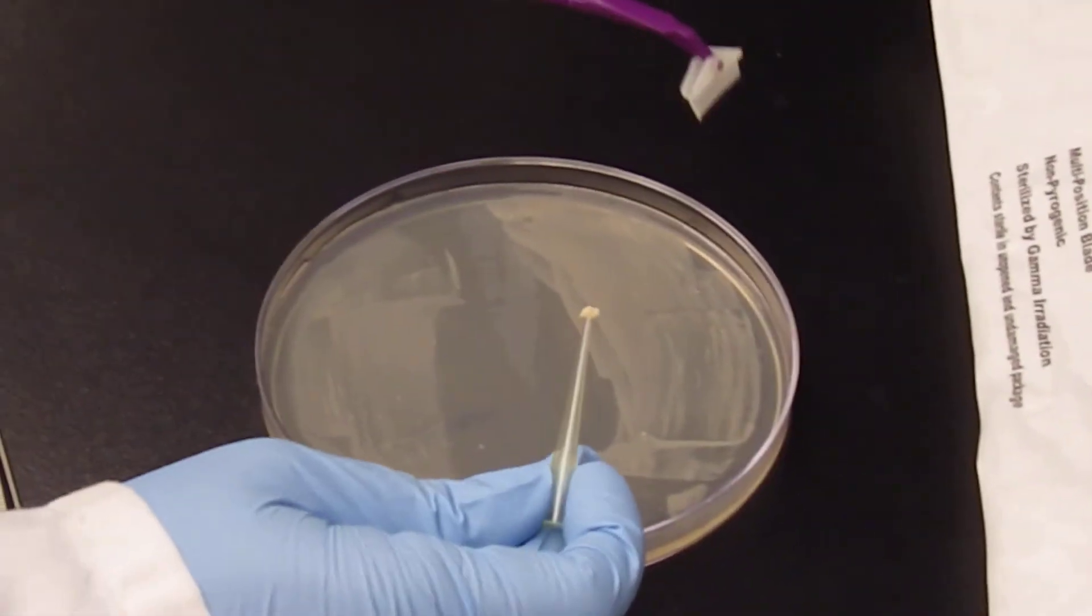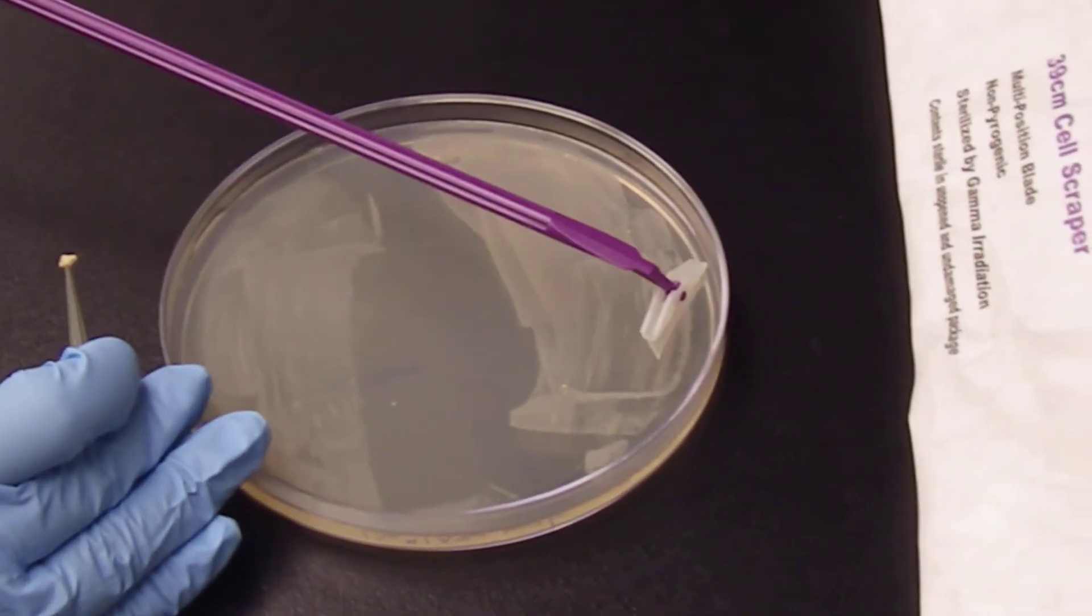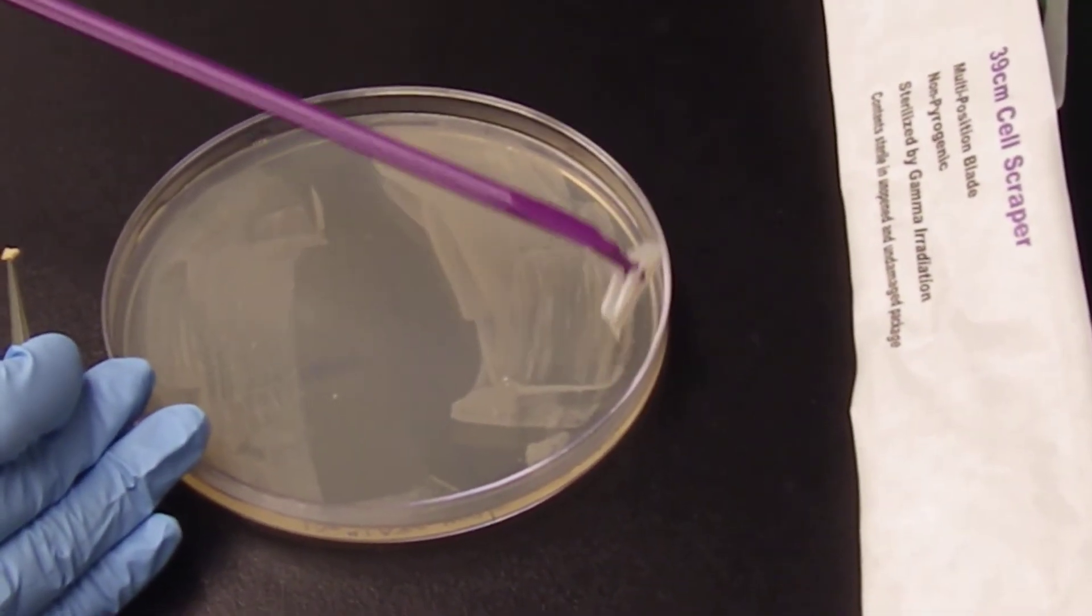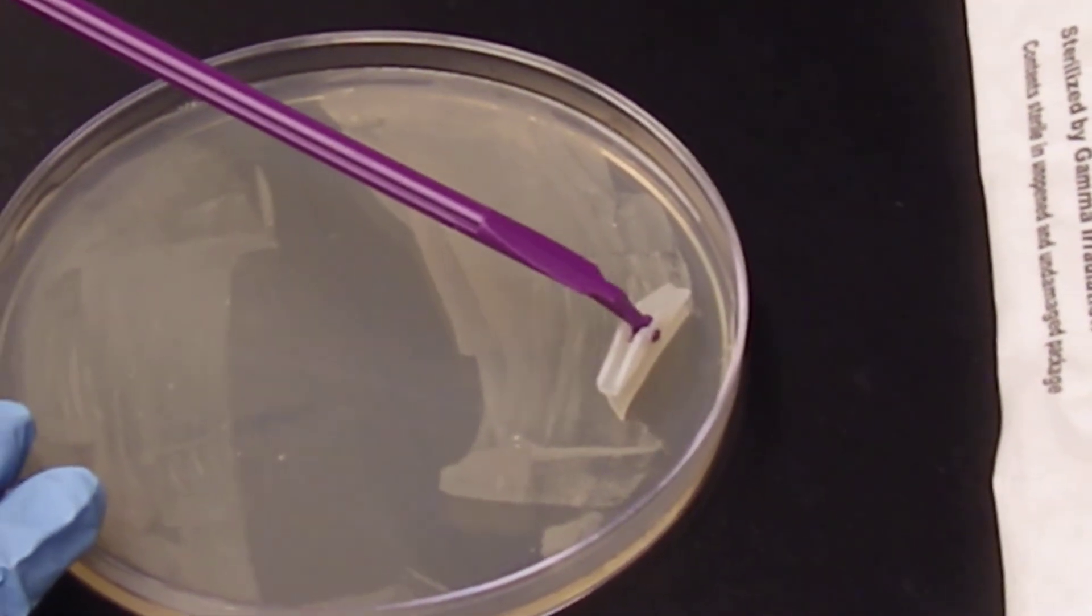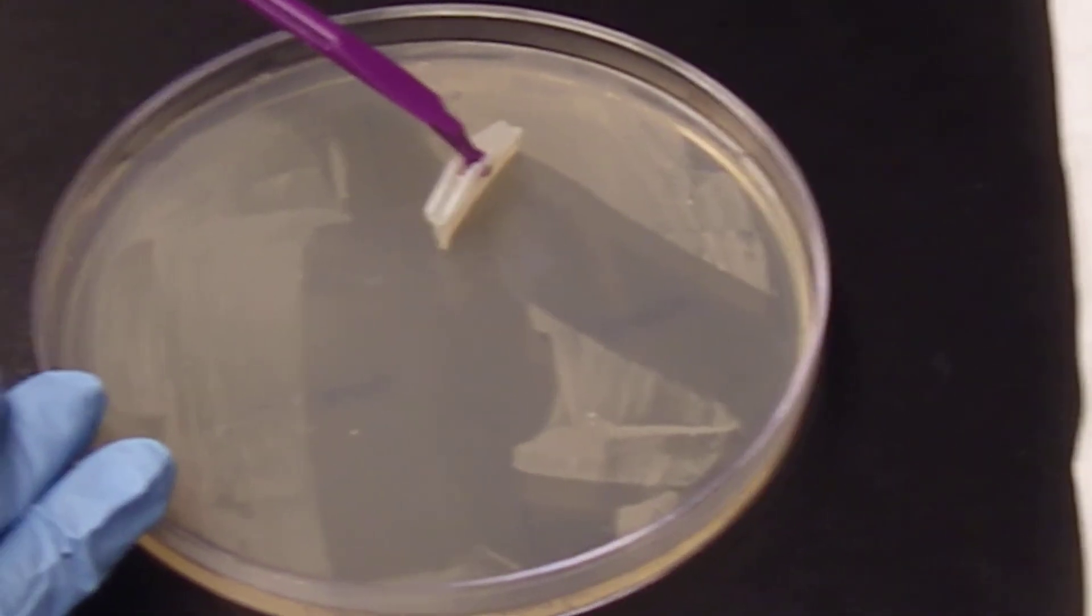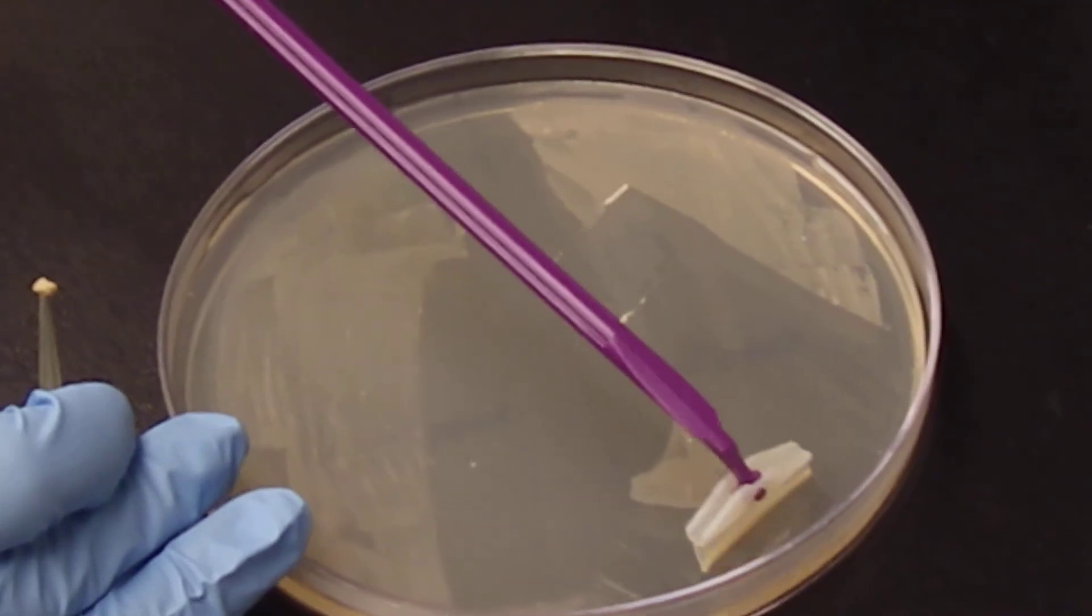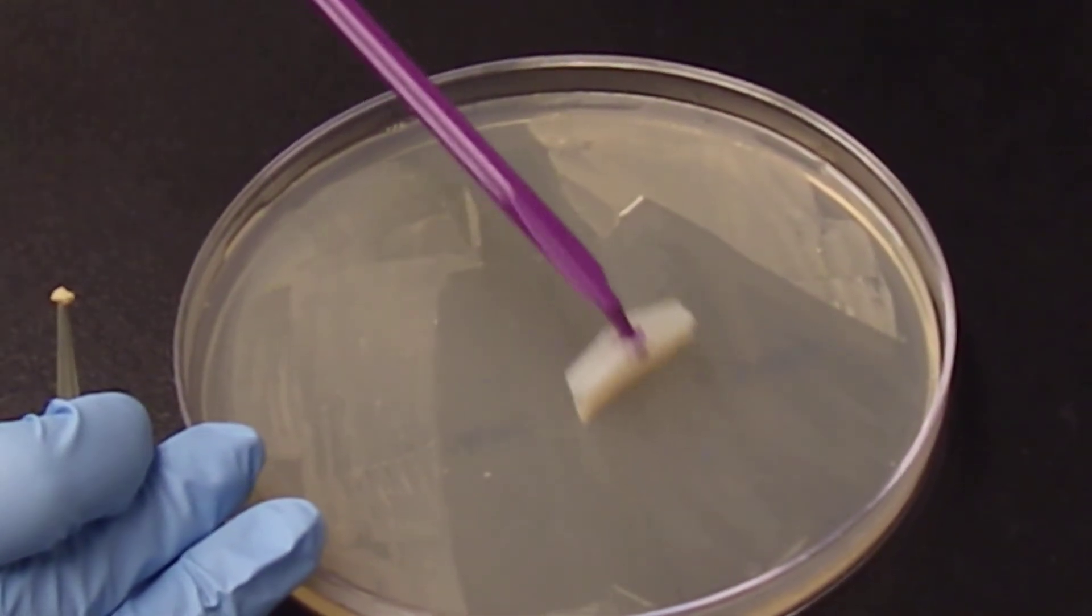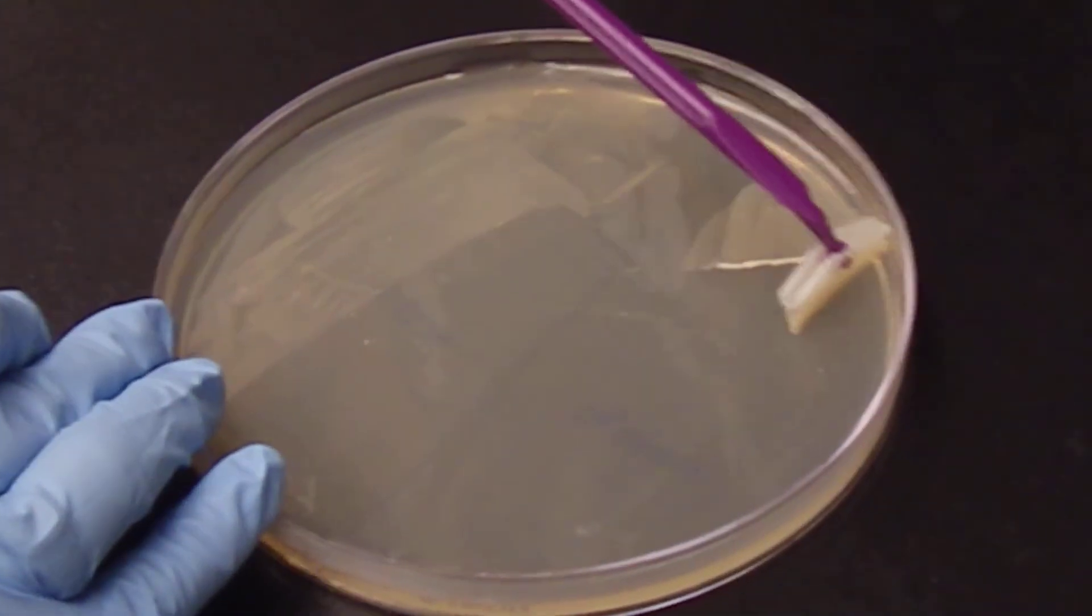I'll show you again how well this works for pulling all the bacteria off the plate. I just put it down onto the gel, and it cleanly takes off all the bacteria. We can do the whole plate like this and scrape all the bacteria off.